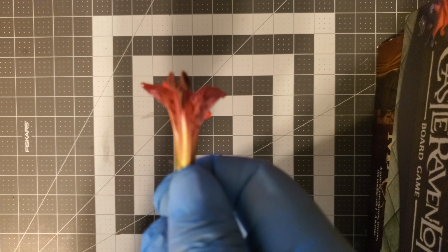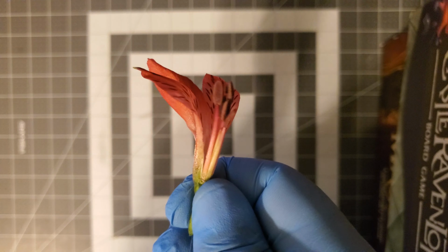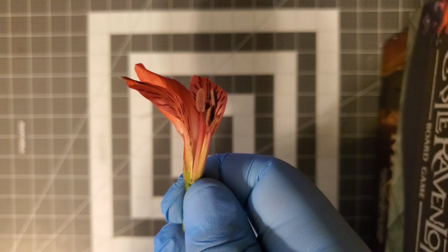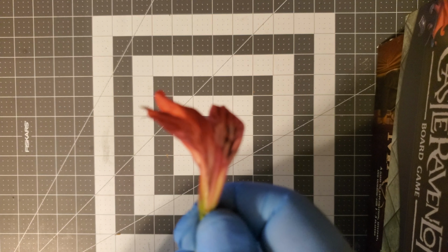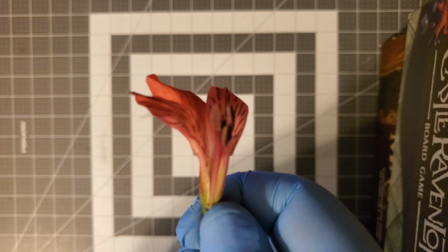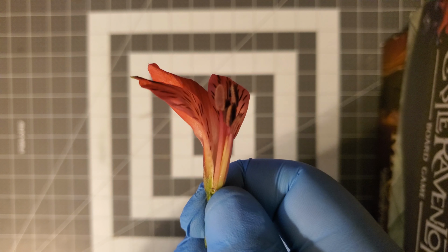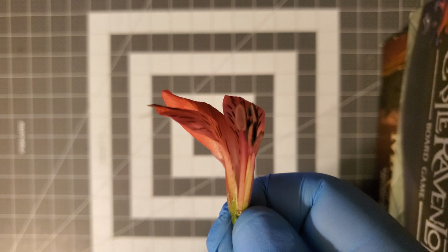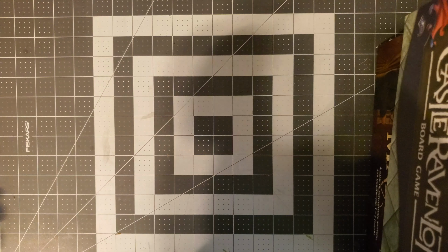So the male reproductive part of this flower is definitely getting the job done by keeping the anther up. The one thing I don't clearly see, however, is the pistil. However, I bought a bunch of flowers, so I have another flower where we're going to be able to see it very visibly. So let's move on to that flower real quick.